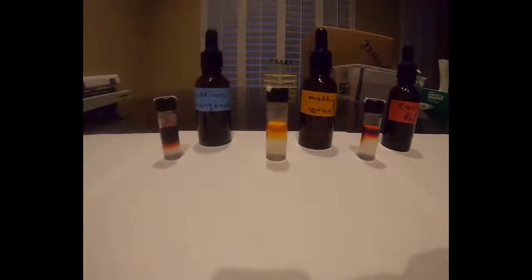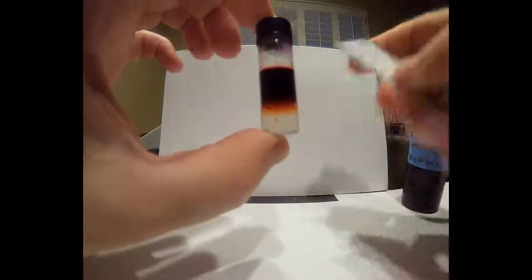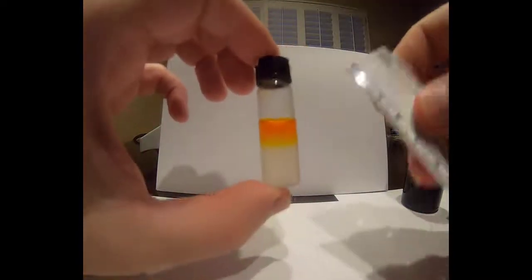We then wait for 2 hours, and at the end of 2 hours our agar columns should look like this. Next, we measure how far each dye has moved in its vial. Here I'm starting with potassium permanganate, and it has diffused about 15 millimeters through the agar. You should record this as part of your data set on page 4. Next, I measured the distance methyl orange moved through its medium. I recorded this as approximately 9 millimeters. This is also part of your data set on page 4.